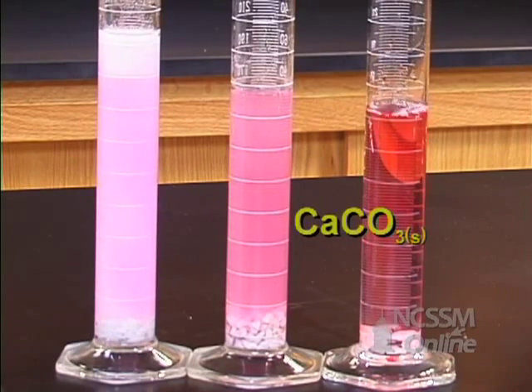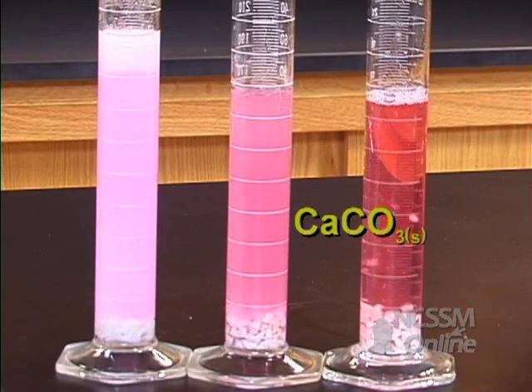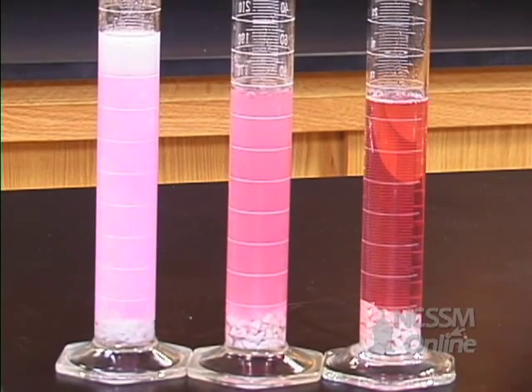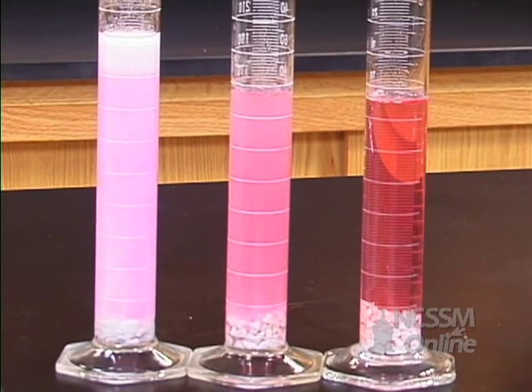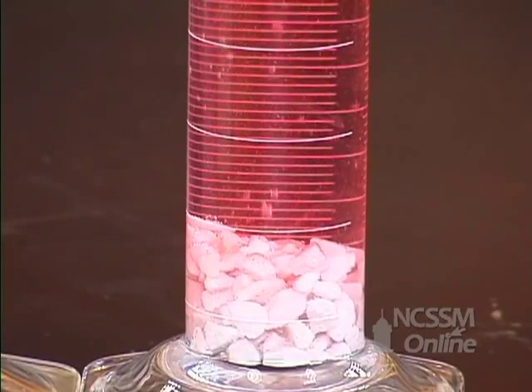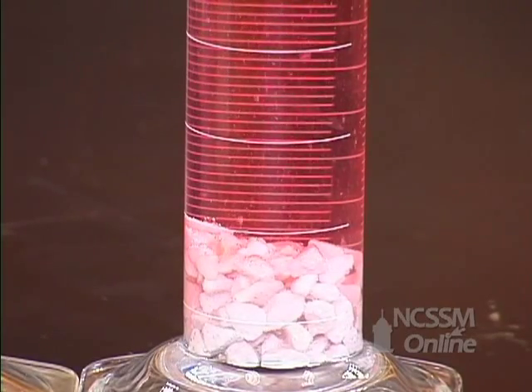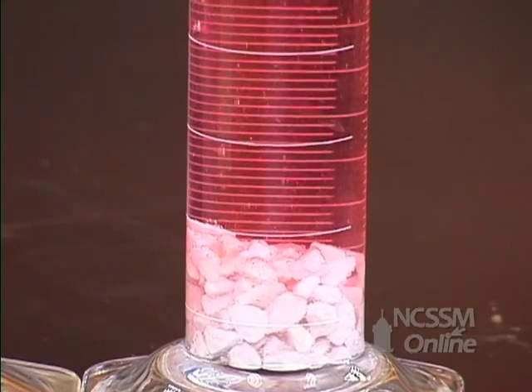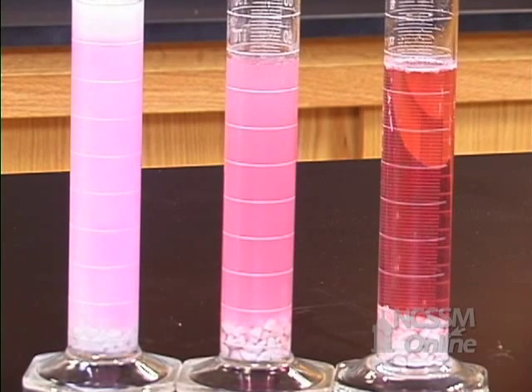We will add the same amount of calcium carbonate to the buffer solution. The buffer solution contains the weak acid and the conjugate base, and it has a higher pH than the solution of just the weak acid. This results in a lower hydrogen ion concentration. We can see the very slow evolution of CO₂ due to this lower hydrogen ion concentration.